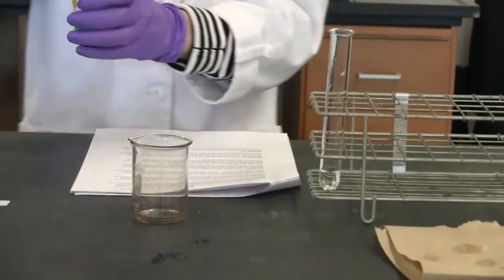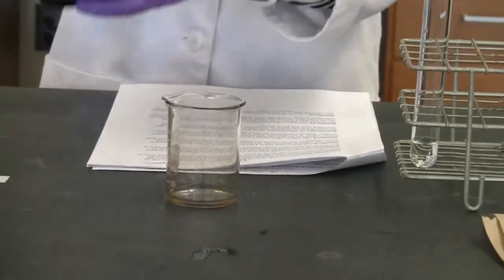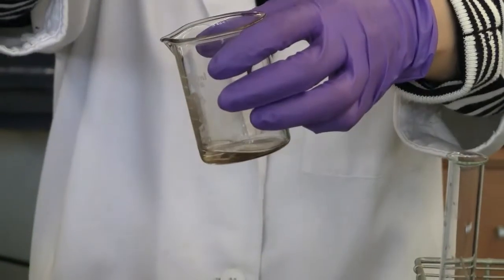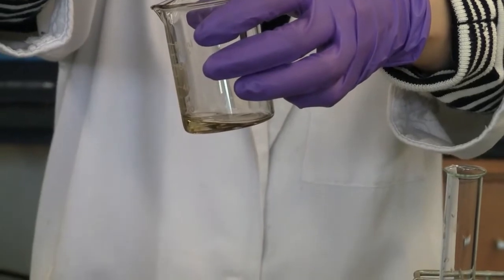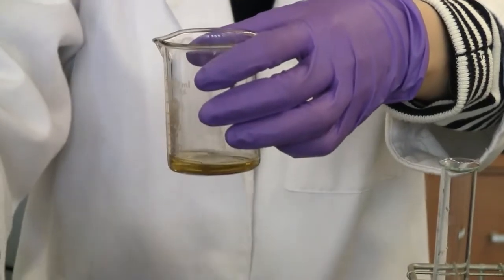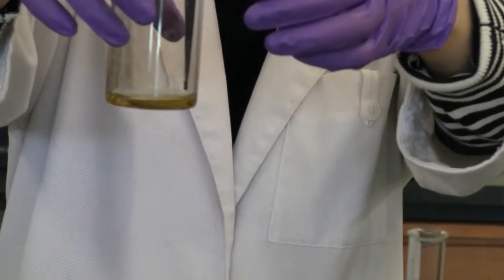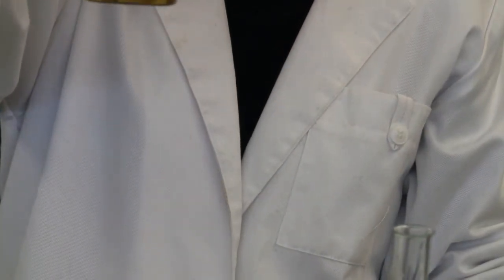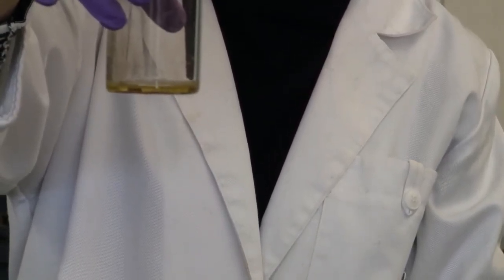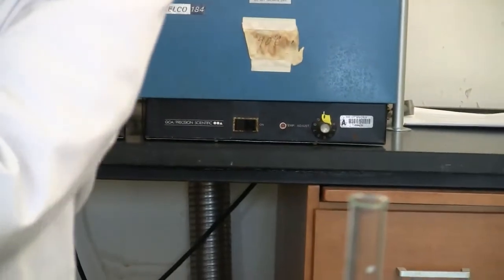But if I add sodium iodide, which is a catalyst, again, do not put this material in the chemical equation. It's just a catalyst. Your starting material, just this one. Okay. But when you add about 1 milliliter, I think the test tube is, well, the yellow color is coming from the iodide. But now you notice something happening here, right on the observation. Okay, all right. That's for reaction 6.